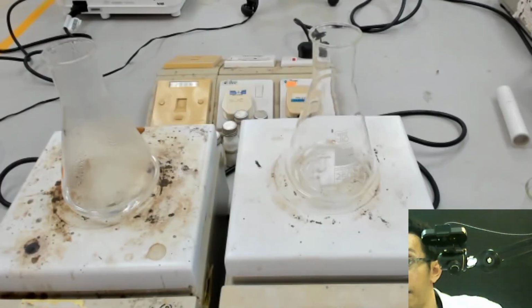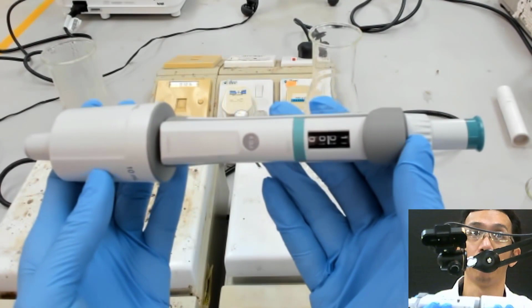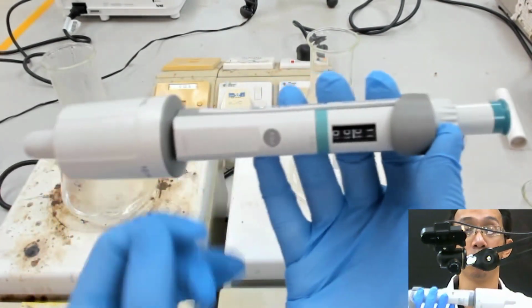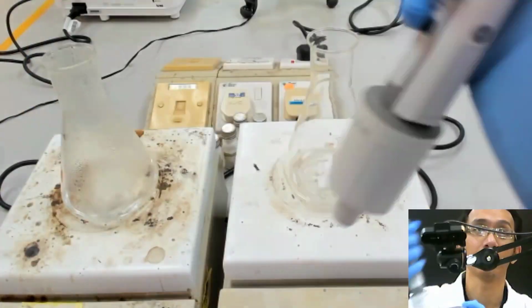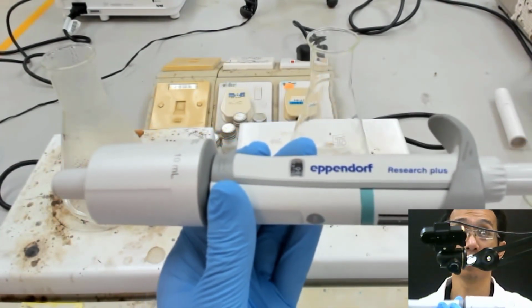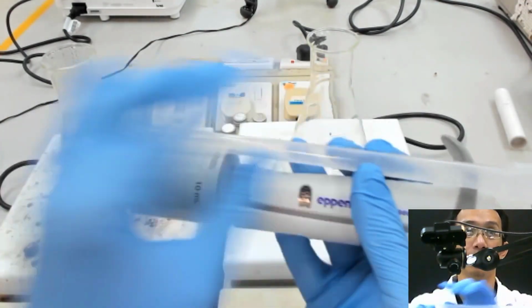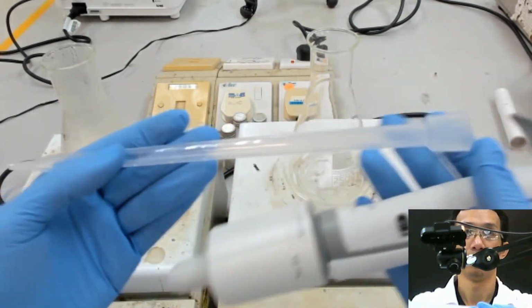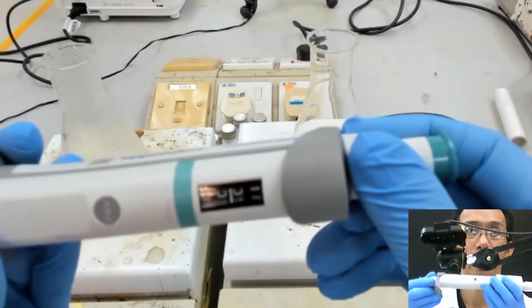So we will use this pipette. This 10 ml pipette. Normally you don't see this in our lab, because this 10 ml pipette is quite rare. Normally you see a 1 ml pipette, but in order to put in 15 ml, you need to do it 15 times. During Dr. Rahat's time you didn't see this, but basically it's the same pipette, just 10 ml. This is what we call the tip for this pipette. You see it's quite big. So we just put it on like that, and then we set it to 10 ml first.